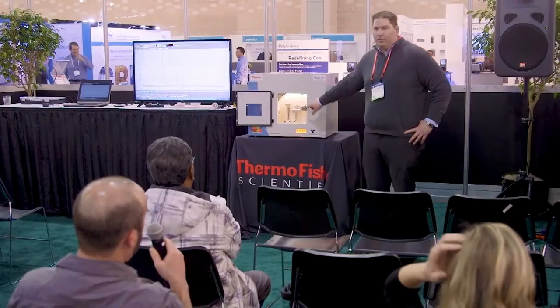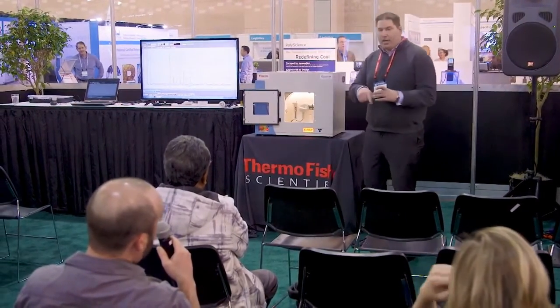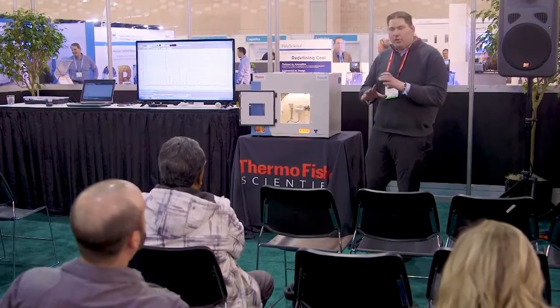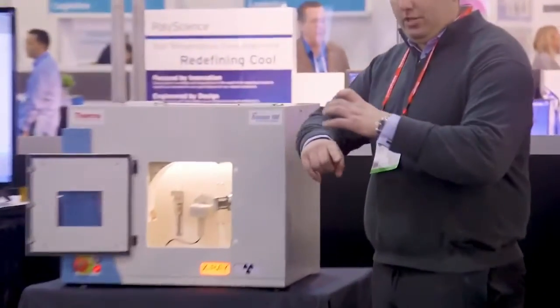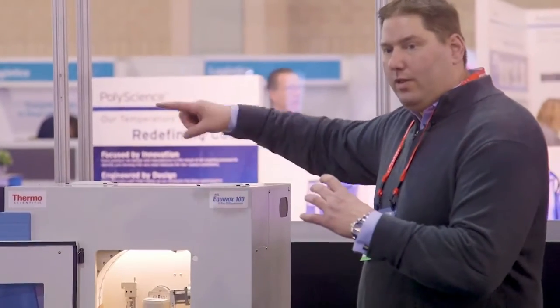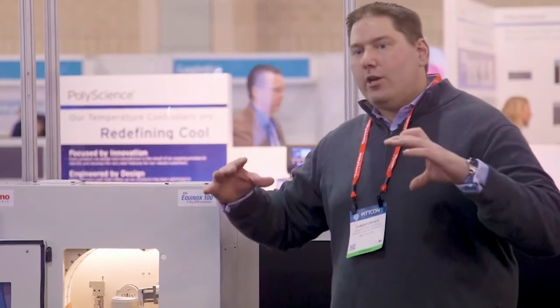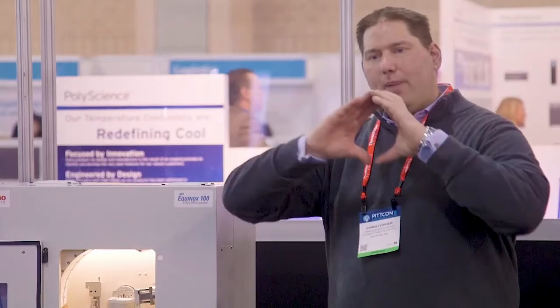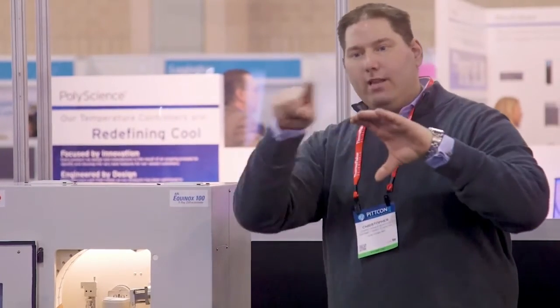The tube does not move, the detector does not move. So the only thing we're seeing is a sample rotation. So the geometry we're doing is what's known as asymmetric or Debye-Scherrer. So it's basically we have diffraction rings going up the whole way through the detector so that we don't have to move anything. So it's essentially, if you're familiar with a Laue technique, you're taking Laue, but instead of getting a pattern shown this way, you're taking that circle and just going the whole way up around it and getting the edge of the pattern up on your detector.